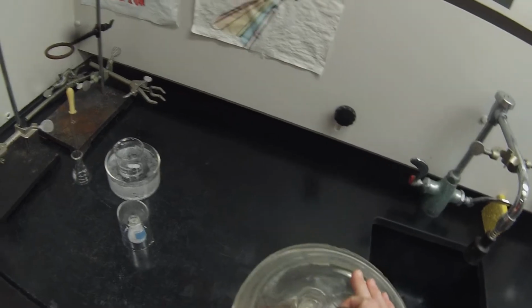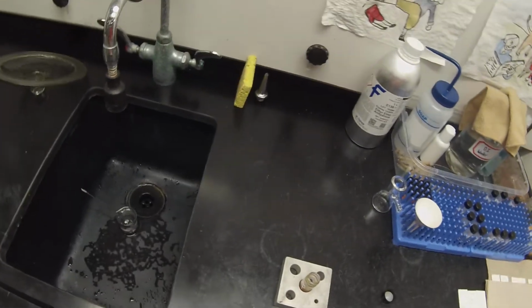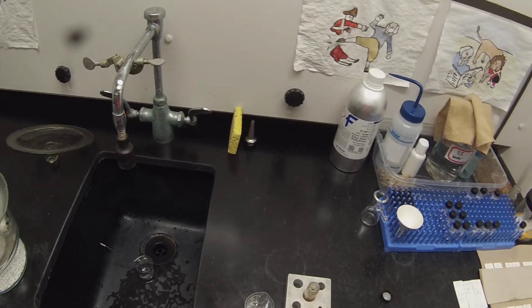It's not ideal to seed it with a different compound, but since I don't have any crystals of the product of the hot reaction, I could think about seeding it with a tiny little bit of the solid from the cold reaction, just to give it something to crystallize on, and there'll be so much less of this than there will of the desired solid that it shouldn't introduce too much impurity. So what I want to do is get one nicely formed crystal.